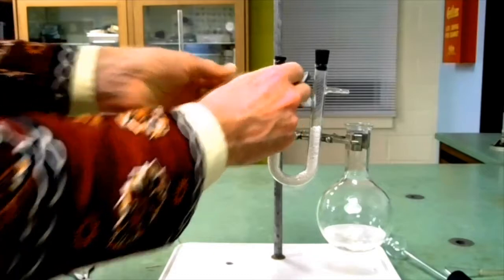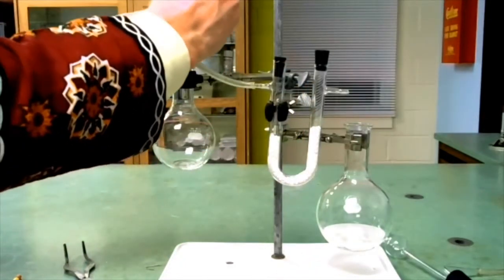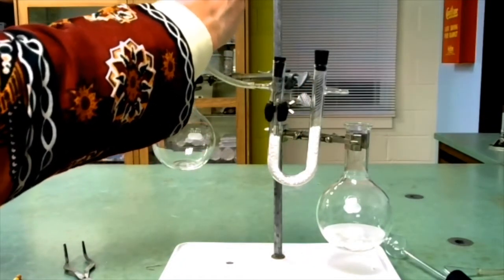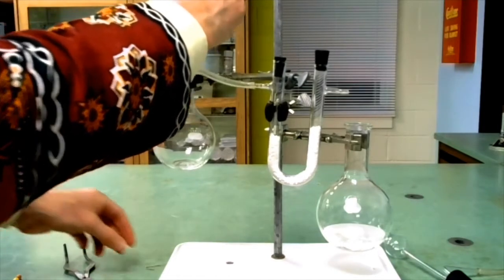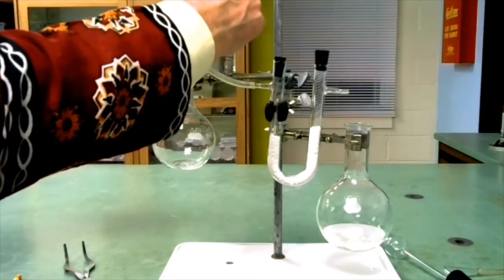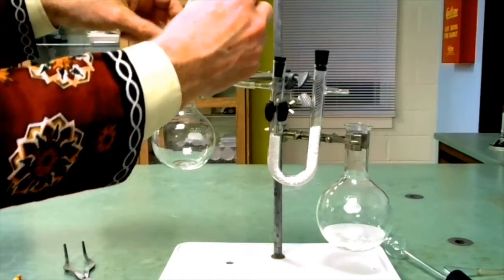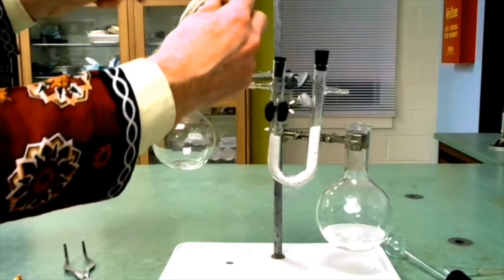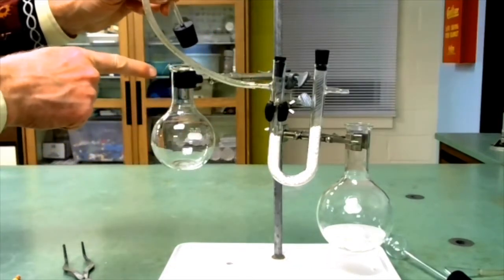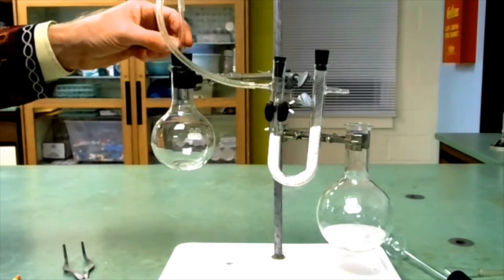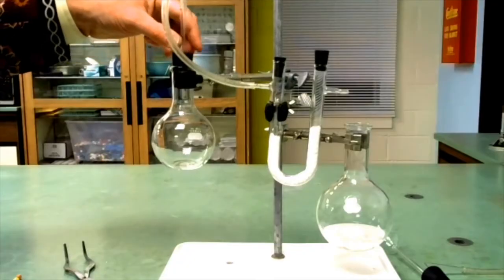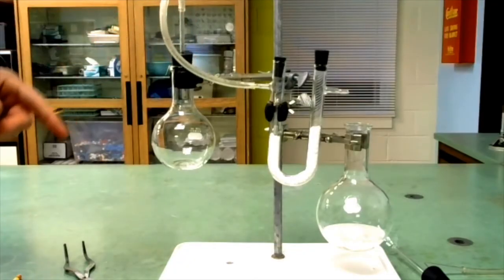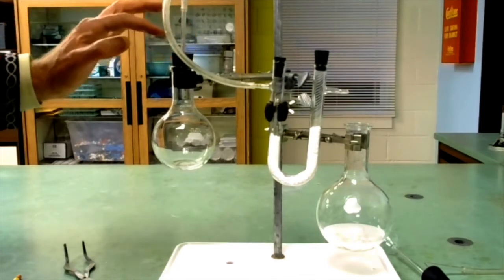Put on the transfer tubing. Now this is not supposed to be tight. We want the carbon dioxide to come in the tube and then out between the stopper and the flask, so I'm putting a piece of bent wire in there. The bent wire is between the stopper and the flask. Now we don't want it to pop out either, but we do want it to hold in place.